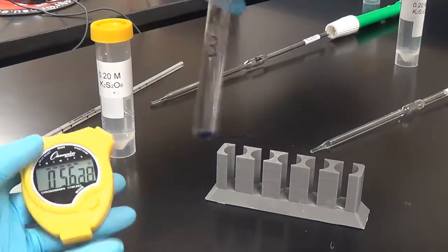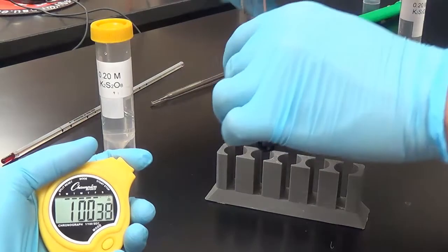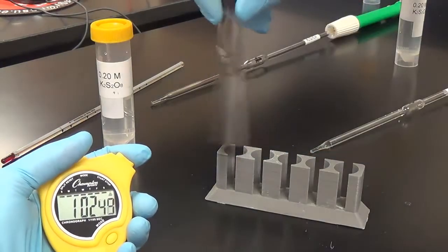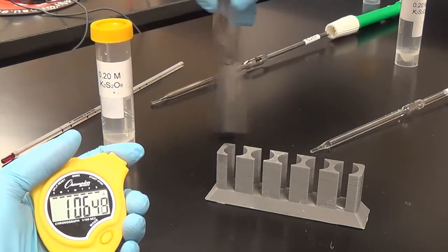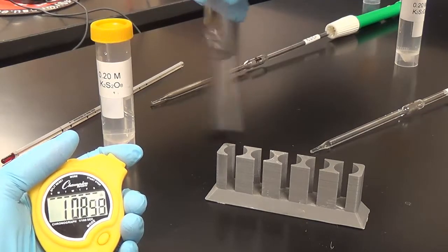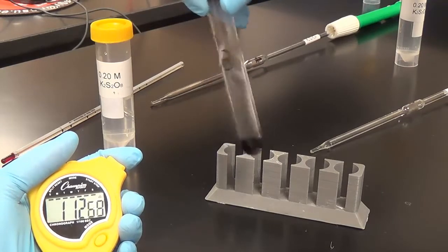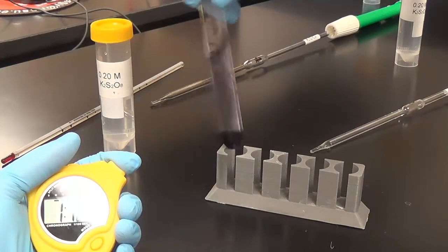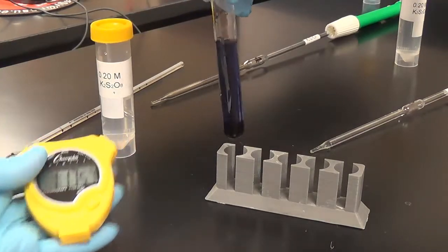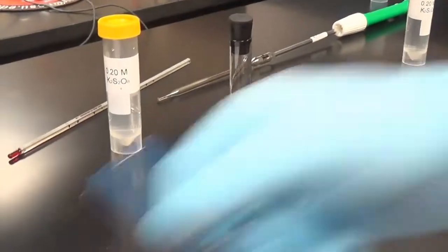All right, stuff is happening here. So, keep on going with that shaking. There we go. Nice. 1 minute and 17 seconds.